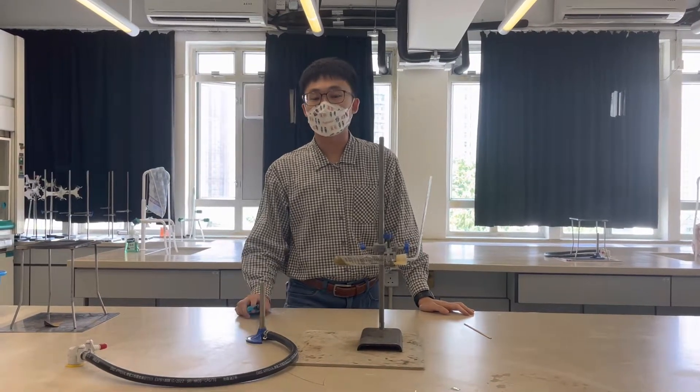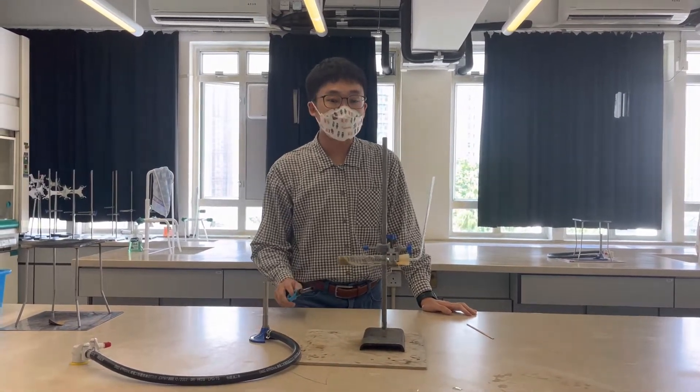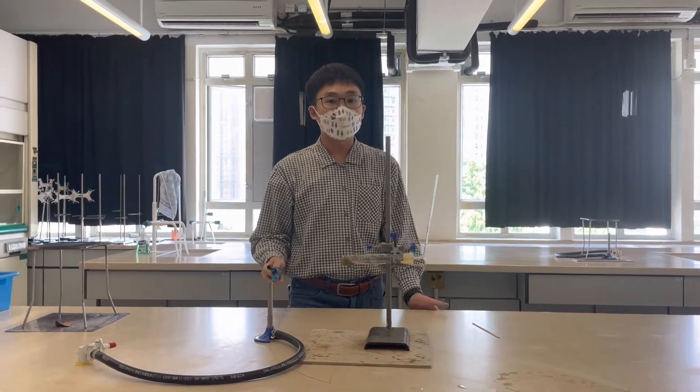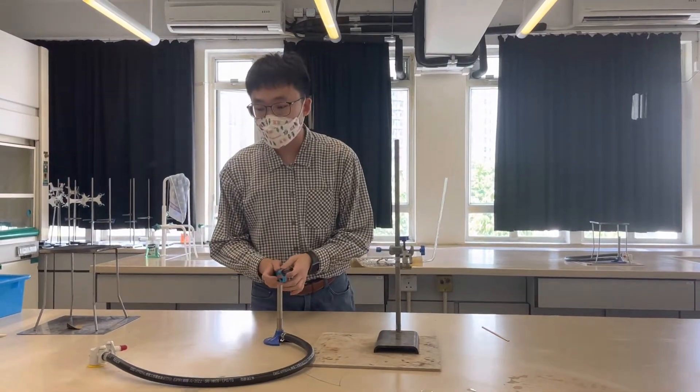Today we are going to demonstrate an experiment for the reaction between magnesium and steam. That is water in a gaseous state. So right now I'm going to light up a Bunsen burner.